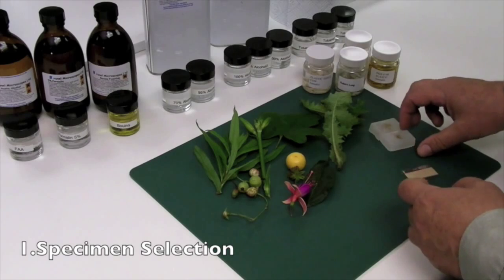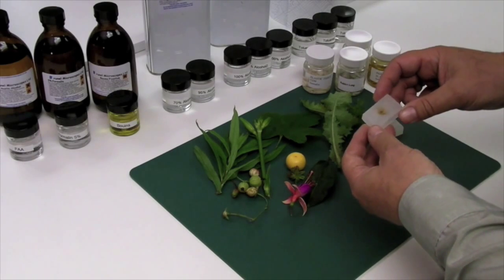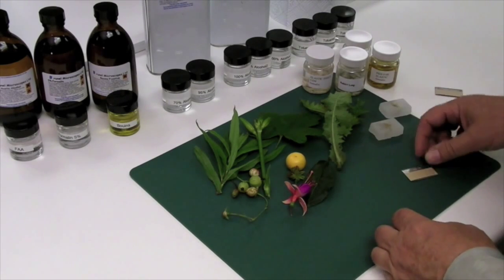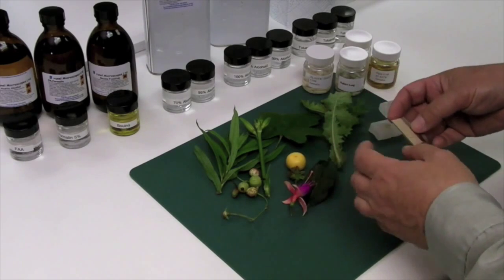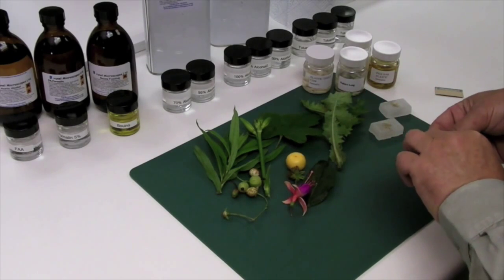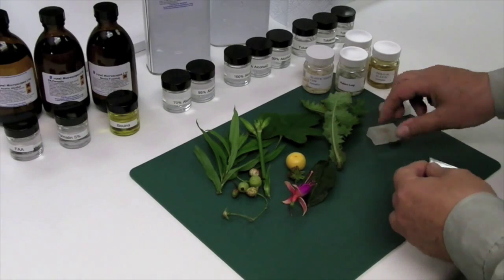This part of the presentation demonstrates how to select pieces from gross specimens that will eventually end up in a paraffin wax block. The choice of these pieces depends very much on the type of finished section you would wish to see.